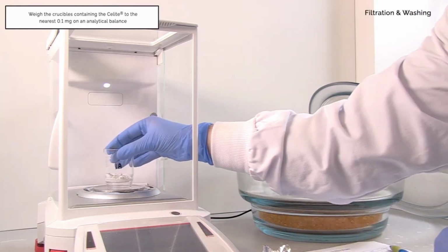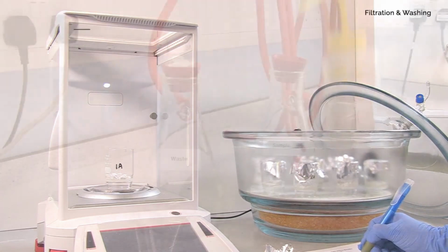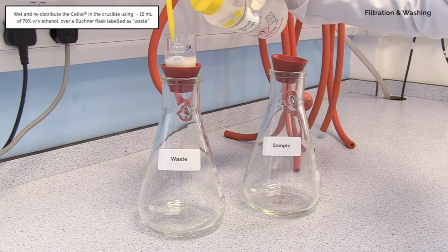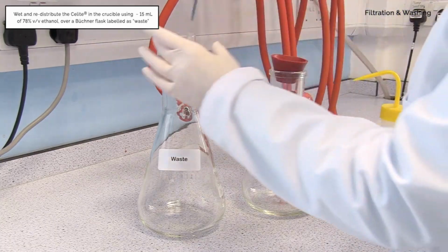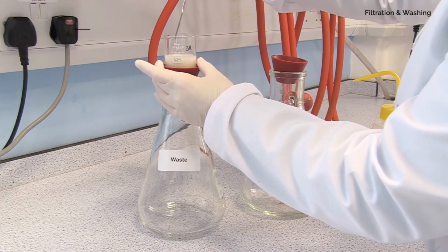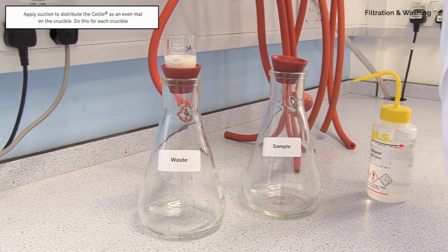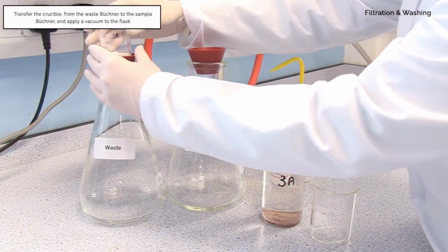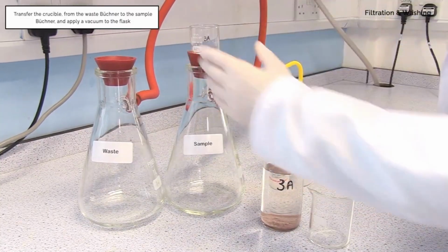Weigh the crucibles containing the Celite to the nearest 0.1 mg on an analytical balance. Wet and redistribute the Celite in the crucible using approximately 15 ml of 78% volume per volume ethanol from a wash bottle over a Buchner flask labelled as waste. Apply suction to distribute the Celite as an even mat on the crucible. Do this for each crucible. Transfer the crucible from the waste Buchner to the sample Buchner and apply a vacuum to the flask.